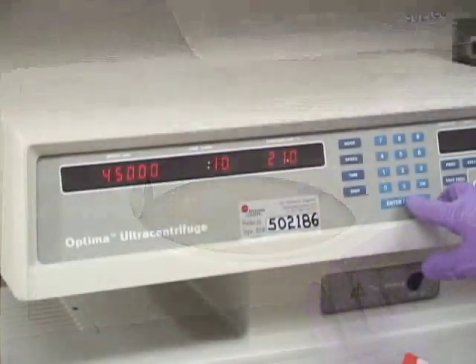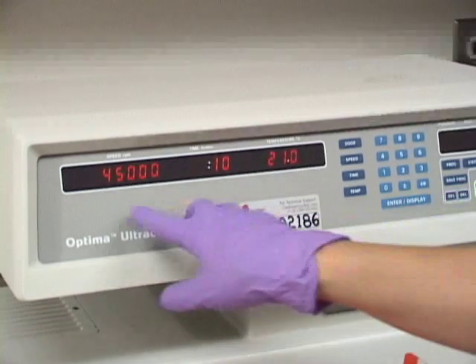Set centrifuge for 45,000 RPM for 10 minutes at 21 degrees.